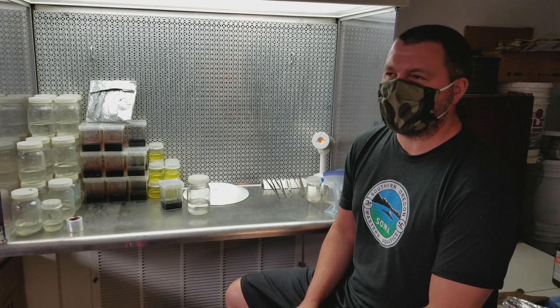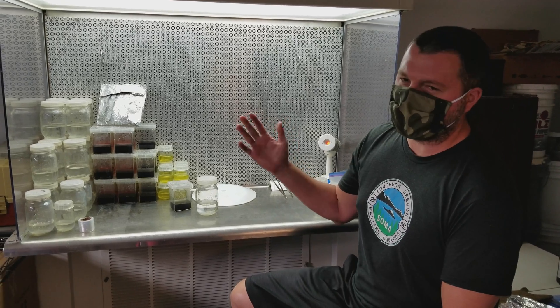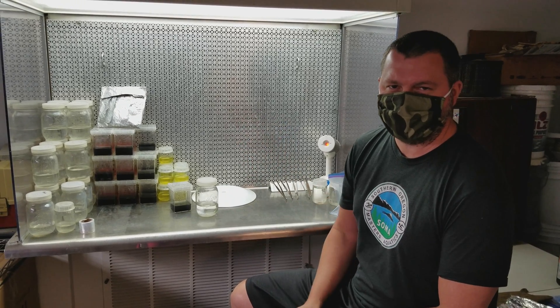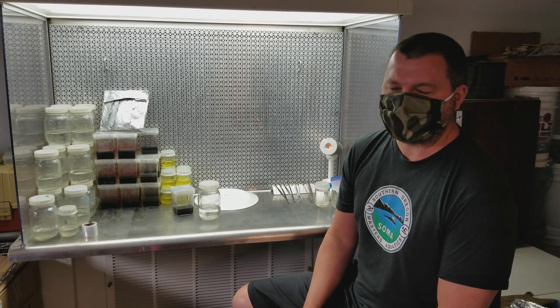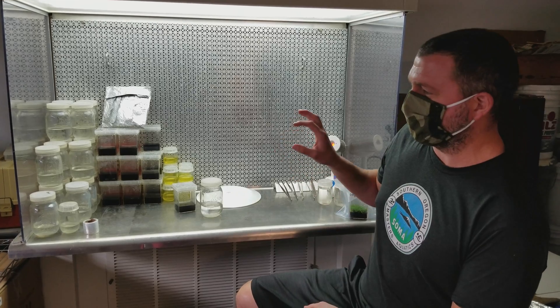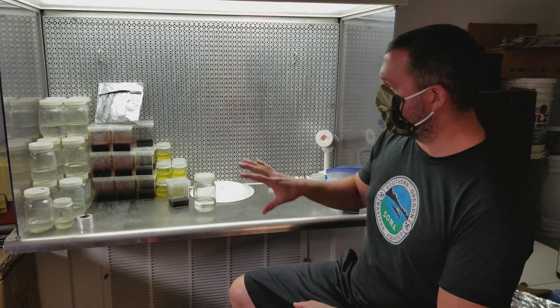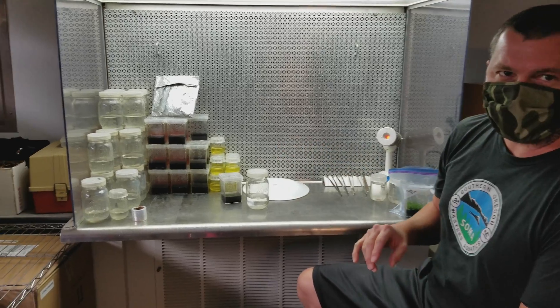Yeah, so typically I don't wear a mask. I'm trying to talk loud so you guys can hear me between the sound of the laminar flow hood that's on behind me and the mask — it might not come out too well in this video. For that reason I'm wearing a mask so that my spray doesn't get into the flow hood. Everything behind me has been sterilized.